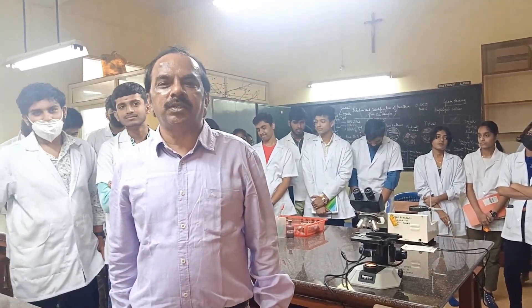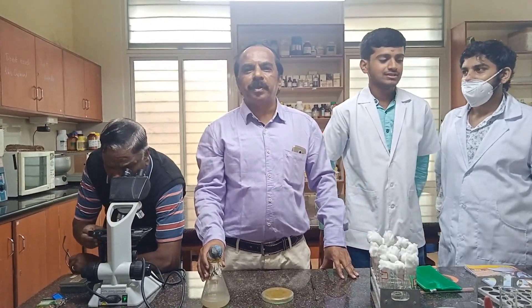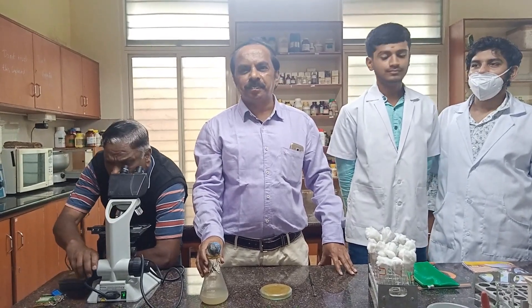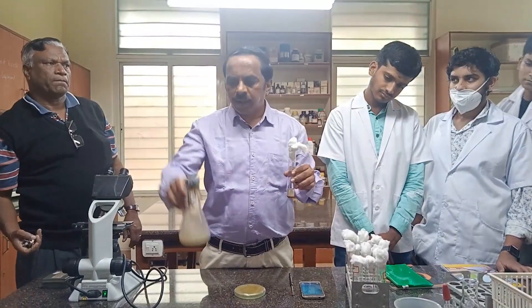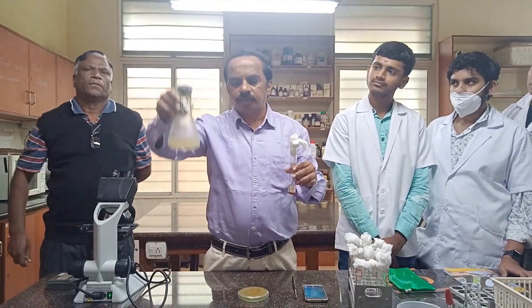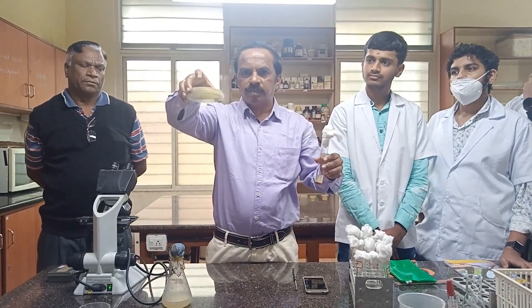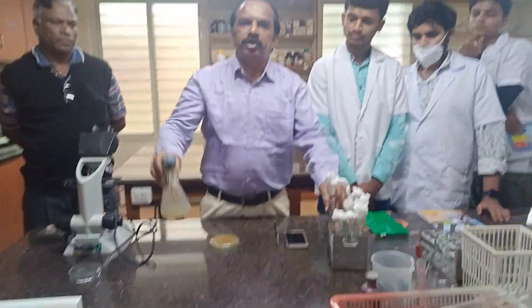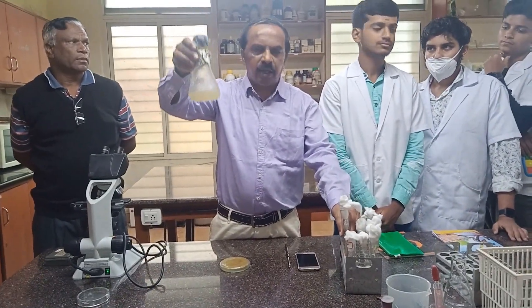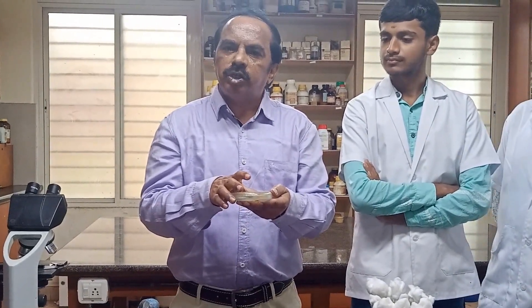To culture microbes like bacteria, we need to prepare a nutrient medium in a conical flask like this. This nutrient medium can be either in a flask, in a test tube, or in a petri dish. Nutrient medium can be in any of these forms. Initially, the nutrient medium is prepared in a flask.